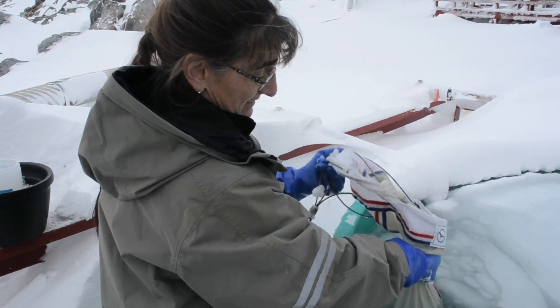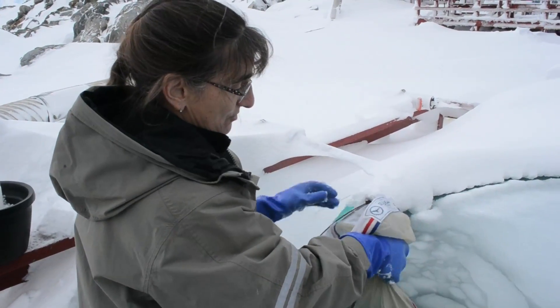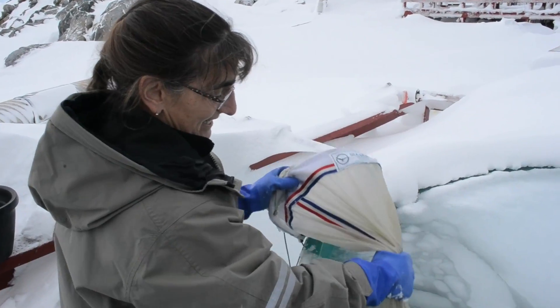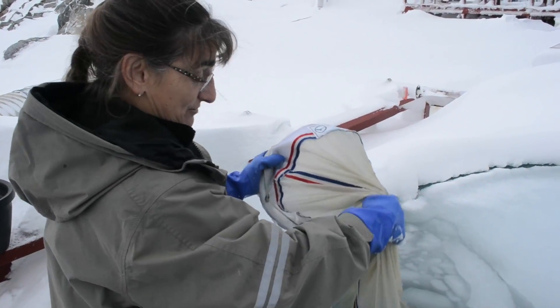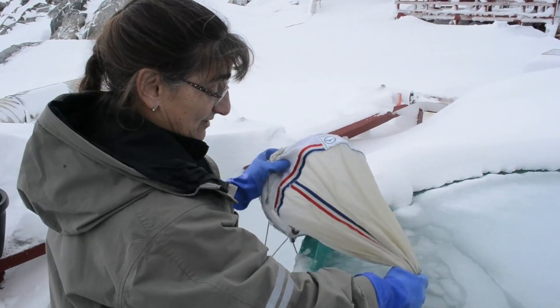The mesh on the net is actually 25 microns, so anything larger than 25 microns stays inside the net, and anything smaller will go right through. We've concentrated the phytoplankton over the course of the 24 hours.